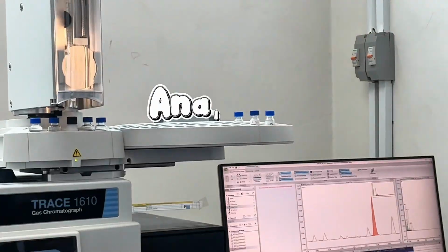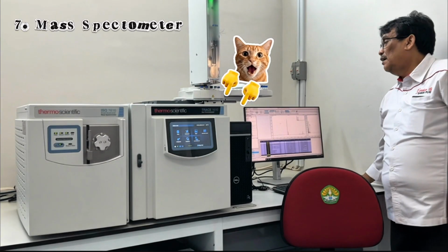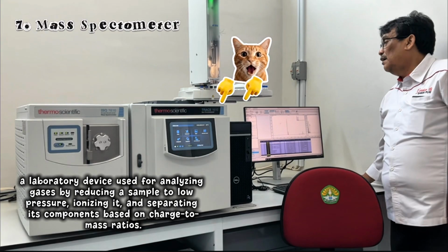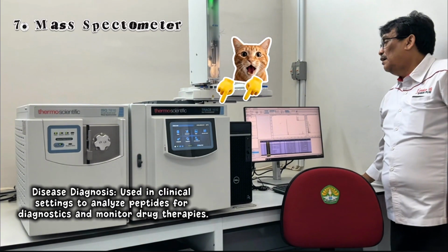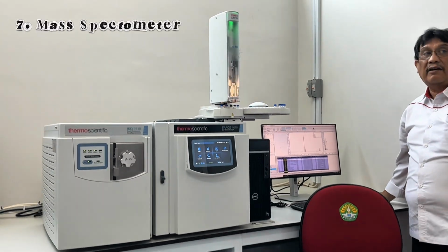Next, we are in the Analytical Chemistry Laboratory. Here, they have the mass spectrometer, a laboratory device used for analyzing gases by reducing a sample to low pressure, ionizing it, and separating its components based on charge-to-mass ratios. It is used in clinical settings to analyze peptides for diagnosis and to monitor drug therapies.